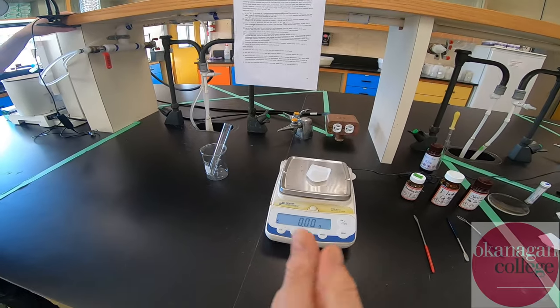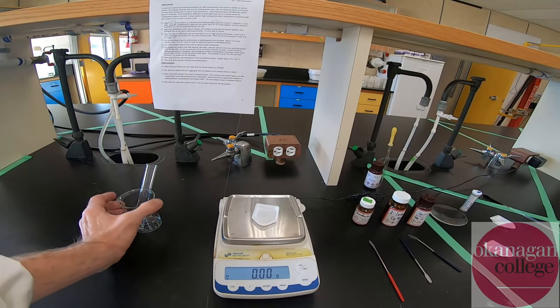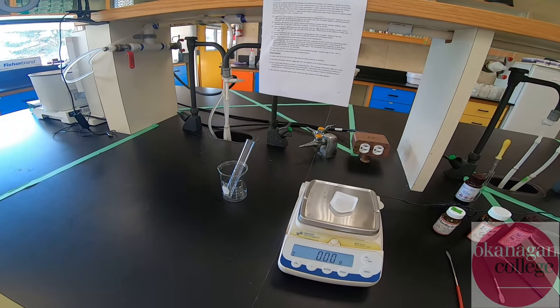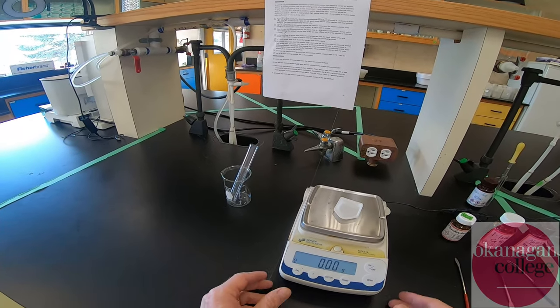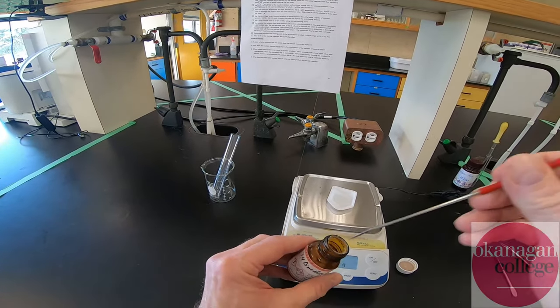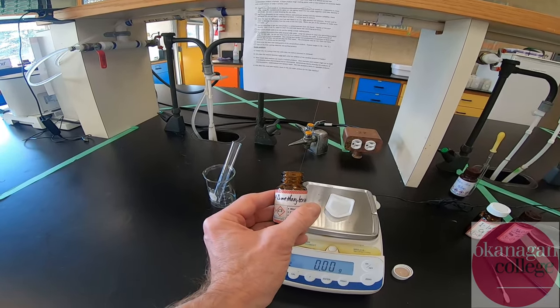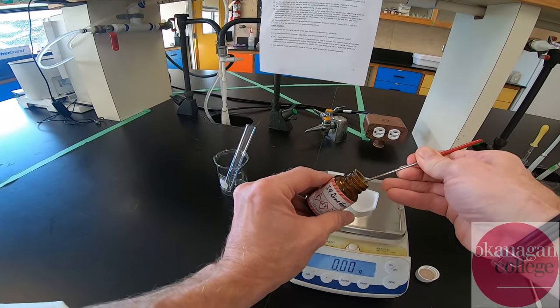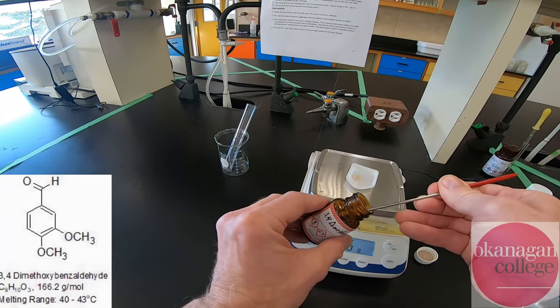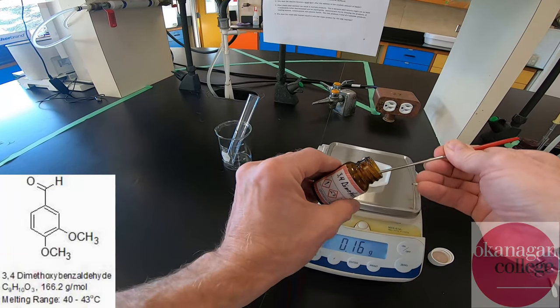We're going to start the solventless aldol. It's a bit of an odd reaction simply because we don't use a solvent — we take advantage of the melting points of the two starting materials being relatively low, and when we mix them we end up with a material that's actually liquid, a homogeneous mixture. The first reagent we're going to use is 0.25 grams of the dimethoxybenzaldehyde. You can see it's a solid at room temperature — the melting point is in the low 40s, high 30s degrees Celsius.